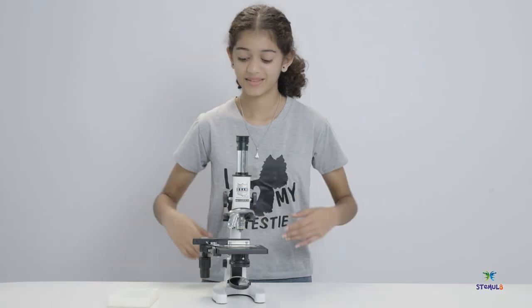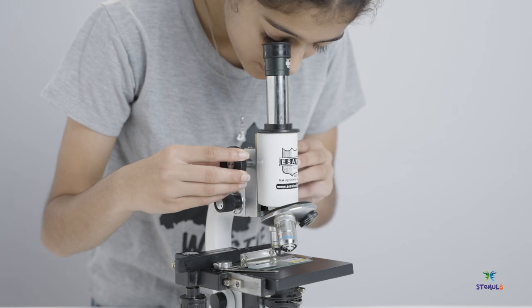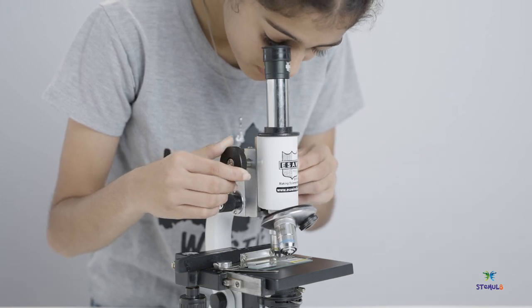Now, look through the eyepiece and rotate the coarse focus knob slowly, until your specimen is in focus.